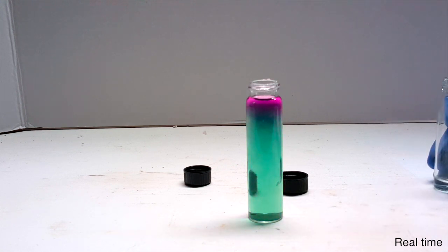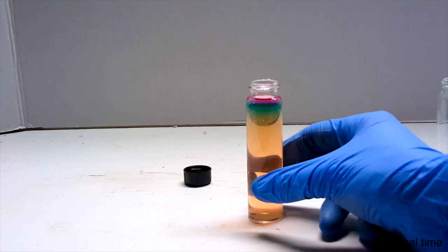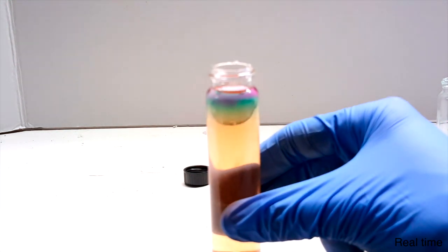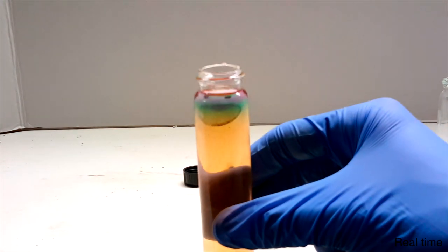When everything was added, you can see a gradient of purple, blue, green, and yellow form at the top of the vial. This was quite unexpected, and happens because the hydroxide solution has a higher density than the permanganate one. The banded color was pretty awesome in my opinion.